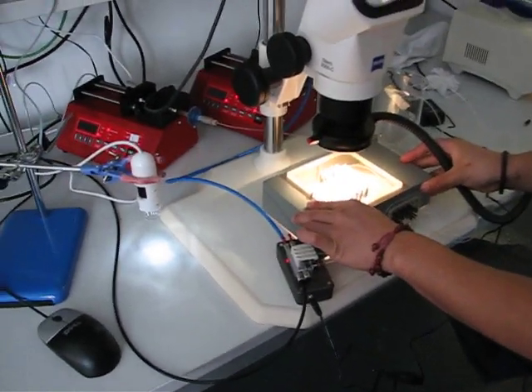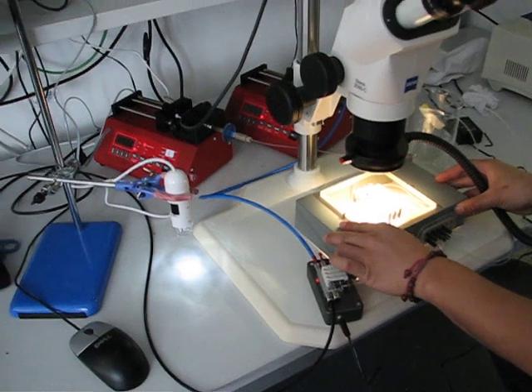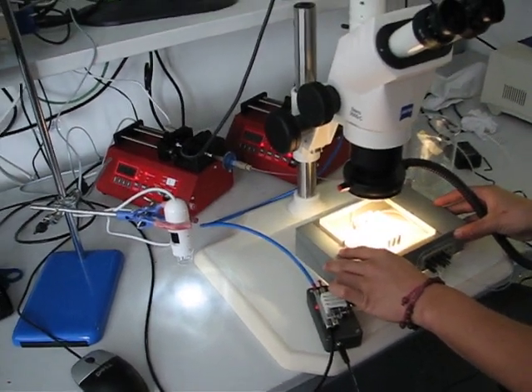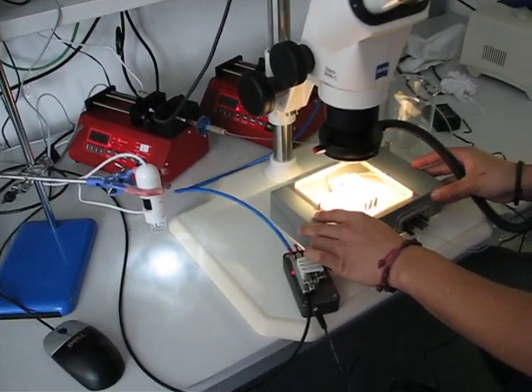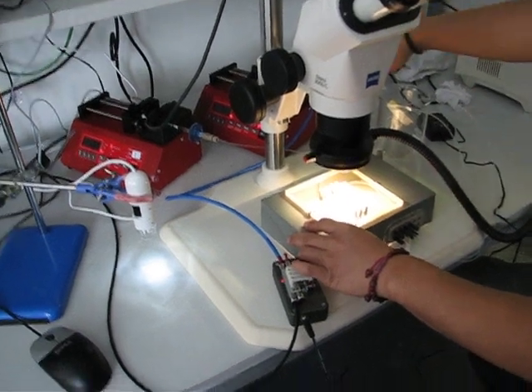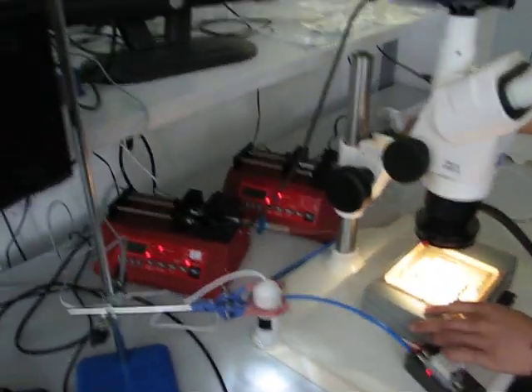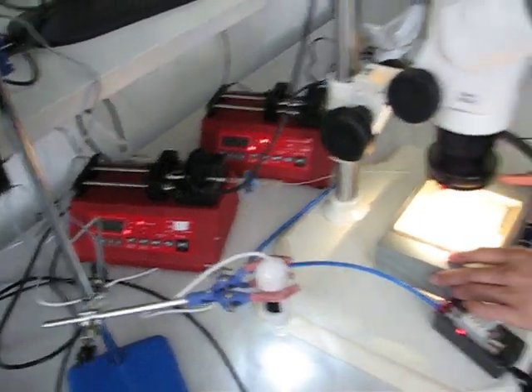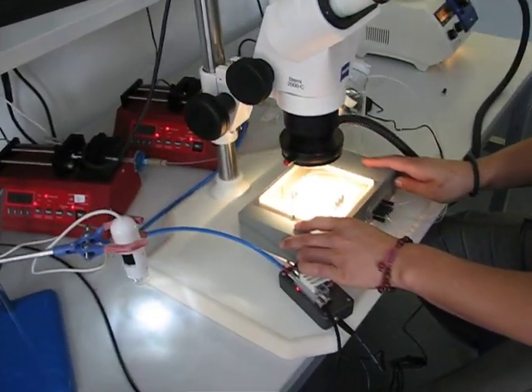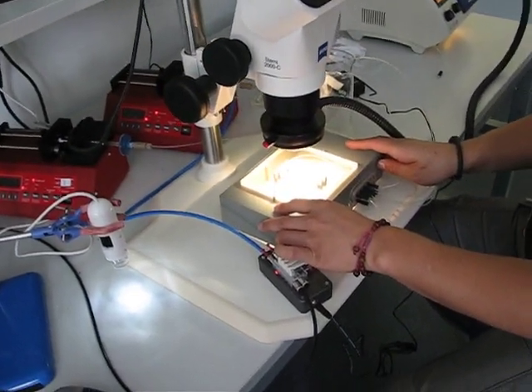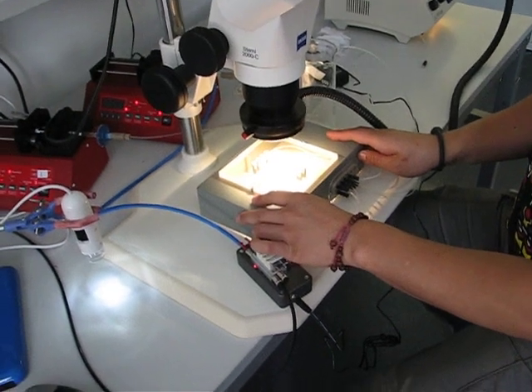And let me just find you where exactly... So, what kind of fluids? Can you tell us something about the fluids? Yes, sure. This is water. And that is oil. This is for demonstration only. But you can also use chemicals depending on application of your experiment.